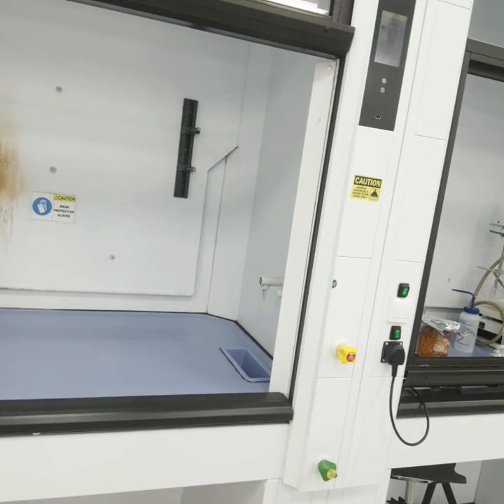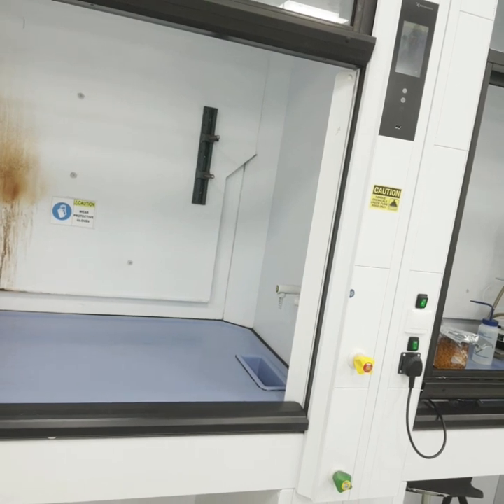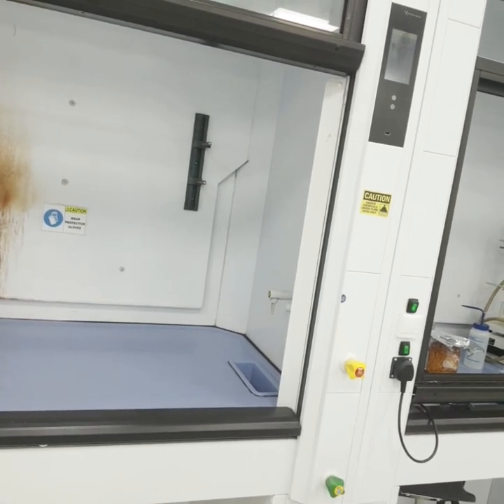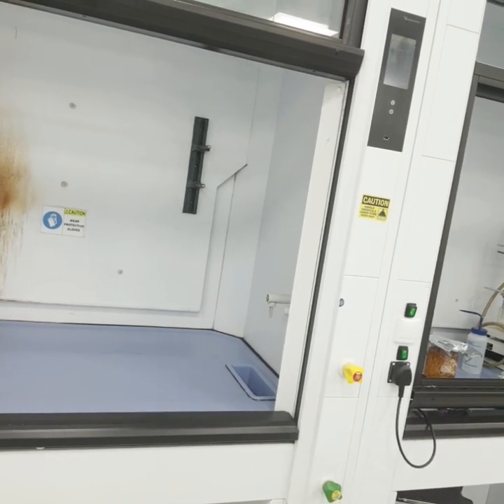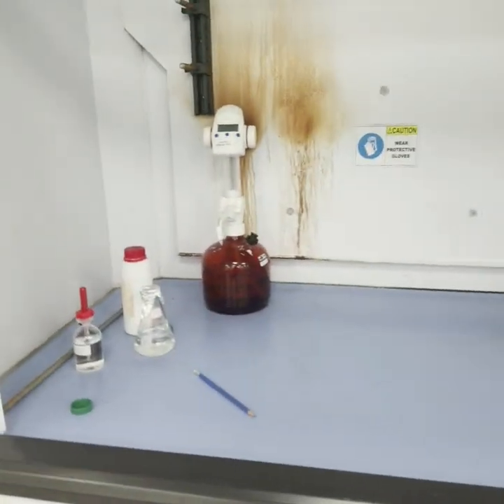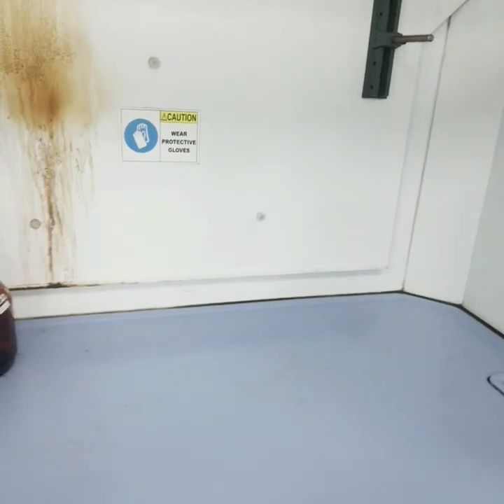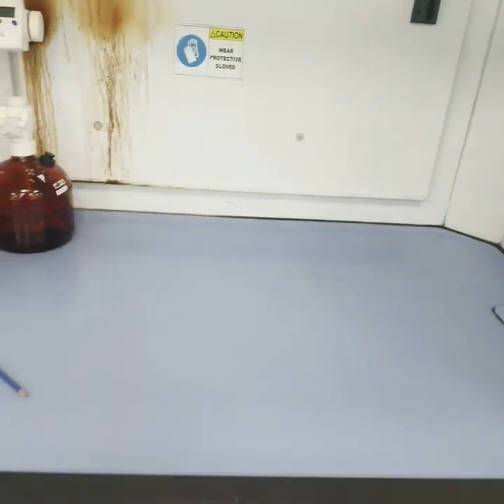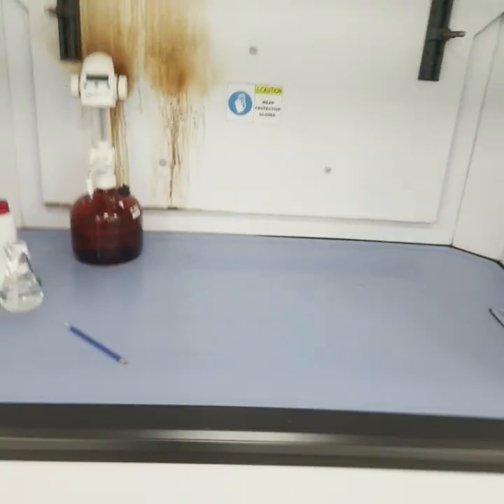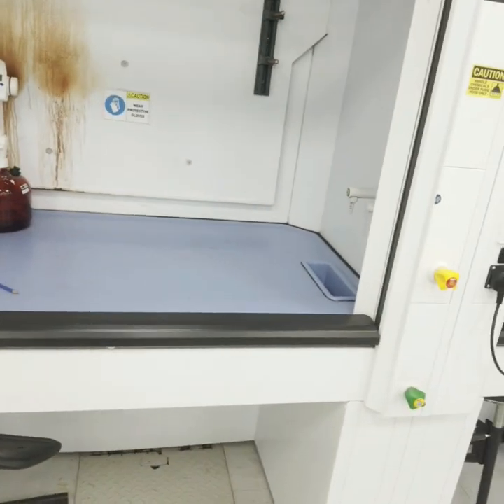The personal protective equipment — PPE — required depends on your application and the type of materials being handled. If you are burning or pyrolyzing something inside a fume hood using a muffle furnace or oven, you must use thermal gloves.